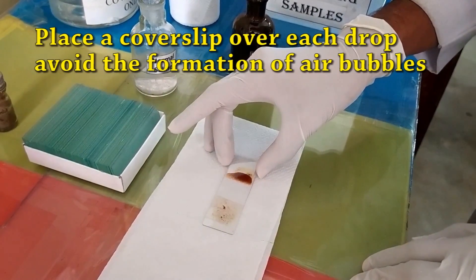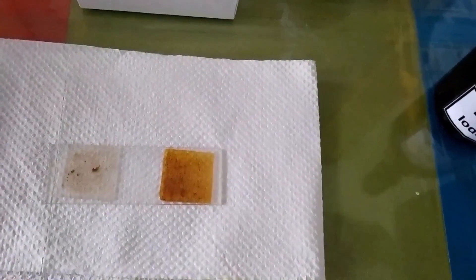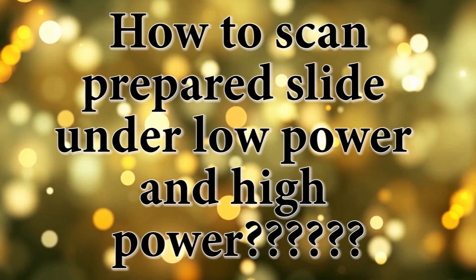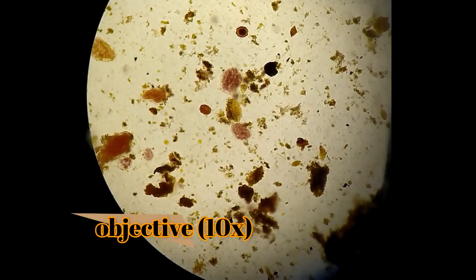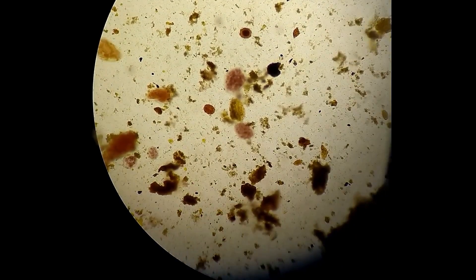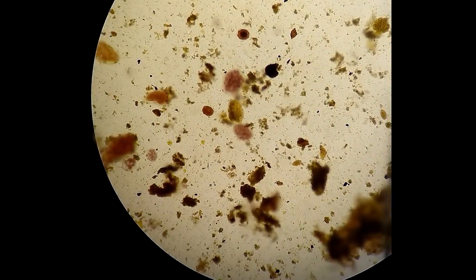Firstly you should examine the saline preparation, after that you should examine the iodine preparation. To scan the prepared slide under low and high power: start at the top left-hand corner using the 10x power objective. When you are able to find some organisms, then you can use the 40x objective to verify your identification.